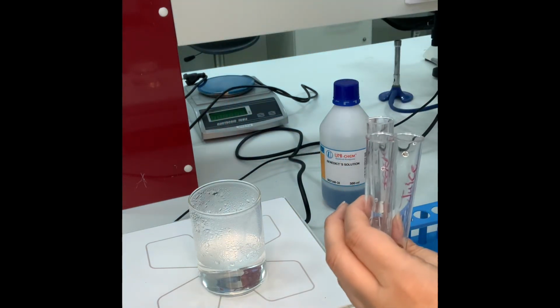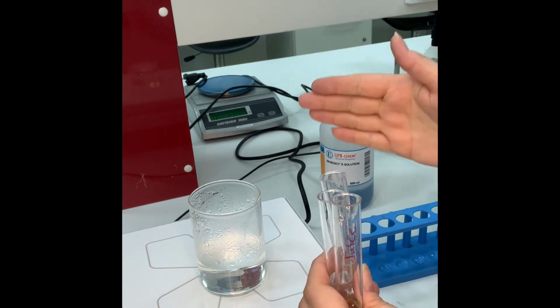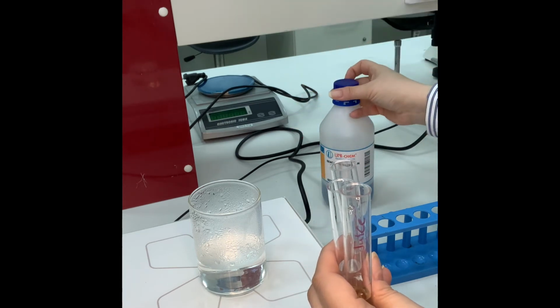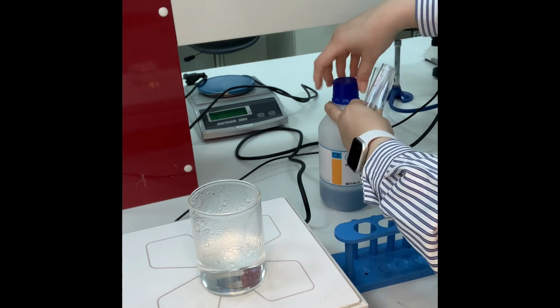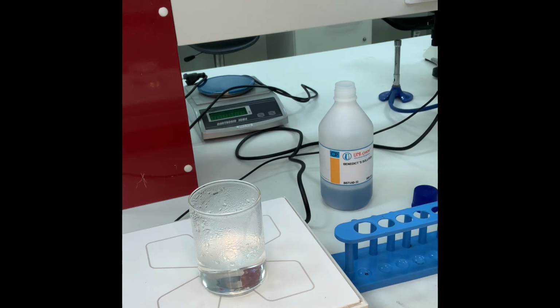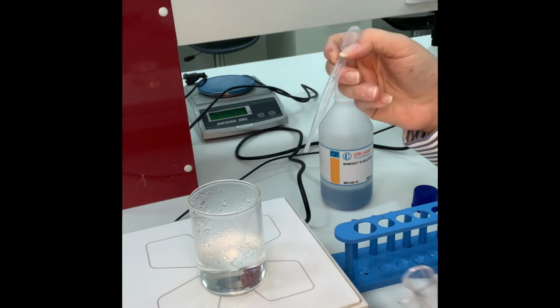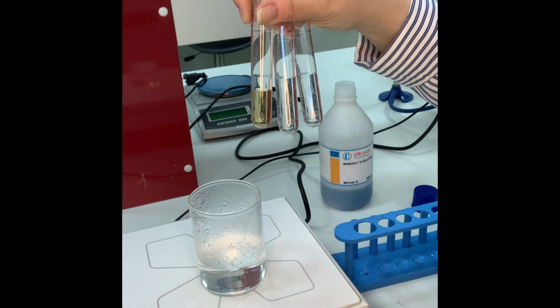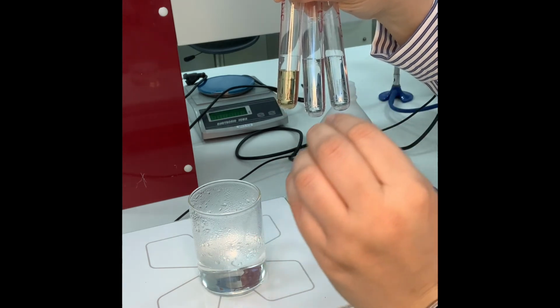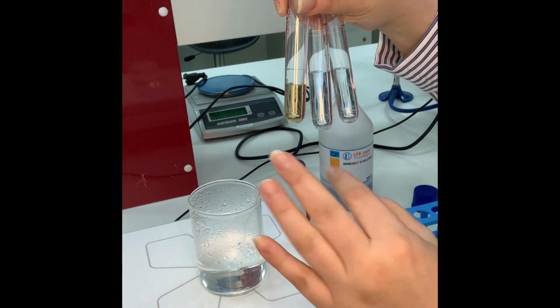Now why do I have to have a negative and positive control for accuracy and precision? I have to have an accurate and precise result. So to prepare that, just let me open it. Now 1 full withdraw of that pipette, actually it counts 1 milli, and I need to have 2 milli over here in each for you to see. I have to have a similar measurement of the sample and the reagent to have an accurate and precise result.